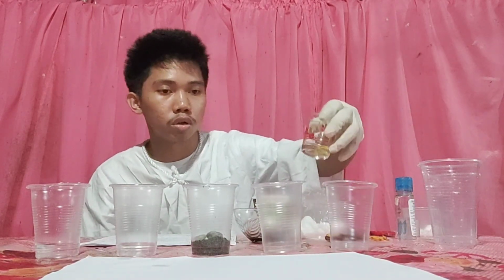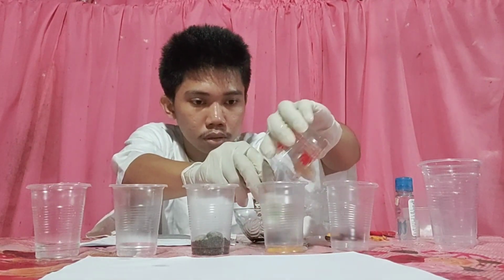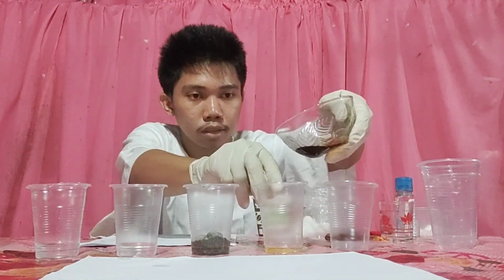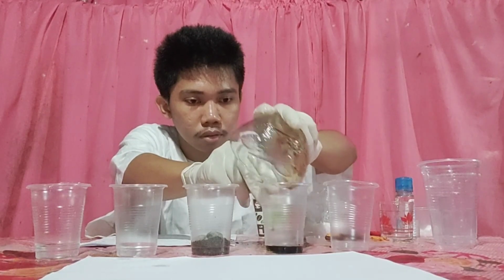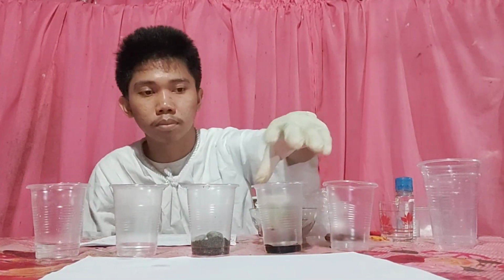So, oil and soy sauce. So we will mix it.